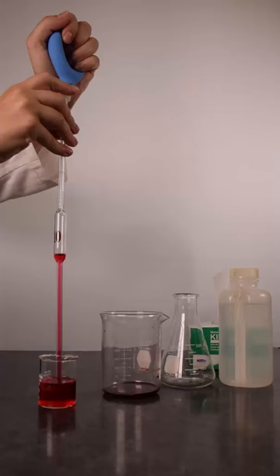You should only require the total volume of a pipette for all three rinses. For example, a 10 milliliter pipette should only require 10 milliliters of solution for all three rinses. See the pipetting practice video for an example of this.